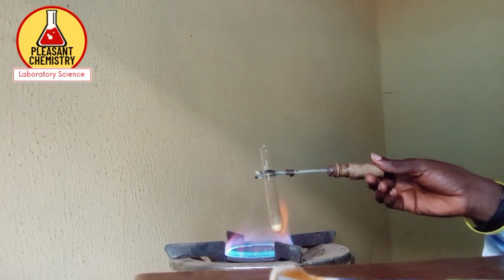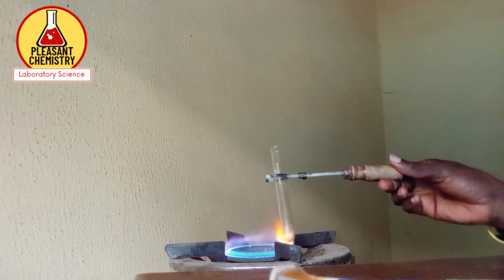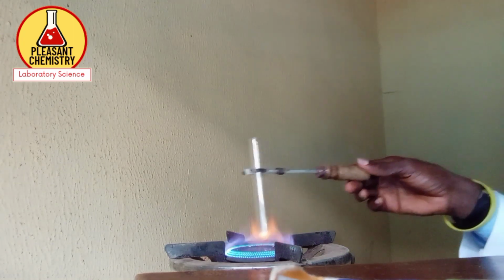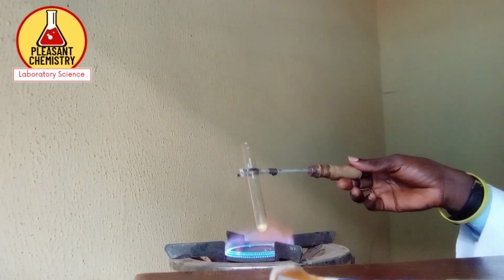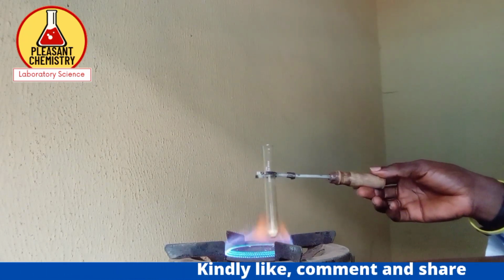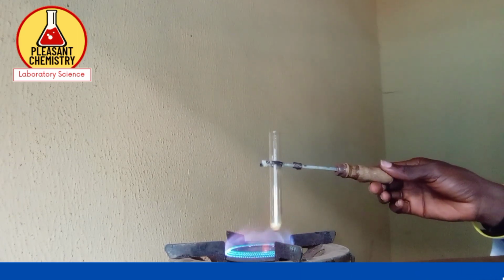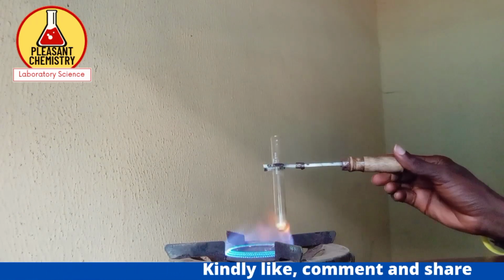It's a colorless and odorless gas which turns lime water milky. Other gases have color. If they don't have color, then they will have a specific odor. And remember, we can only get carbon dioxide from CO3. So my observation is effervescence of a colorless and odorless gas which turns lime water milky, and my inference is the gas is carbon dioxide, CO2, and we can only get CO2 from CO3 2-.